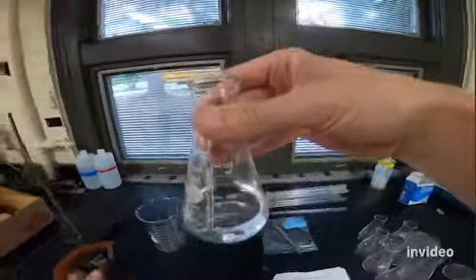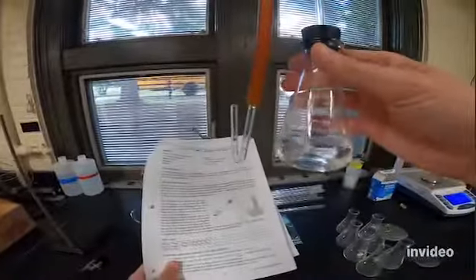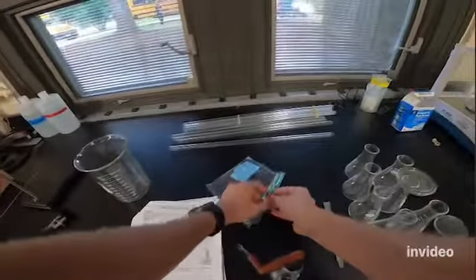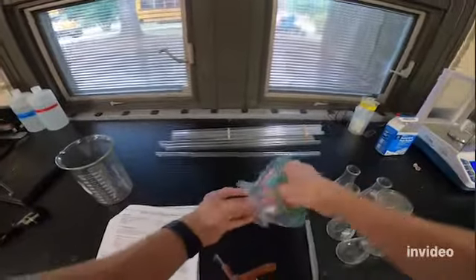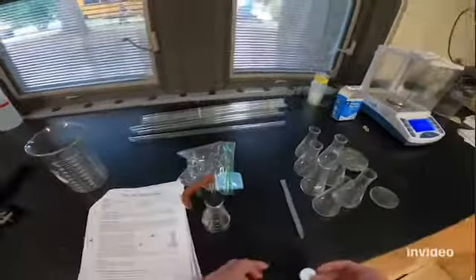Okay, so you can see that I don't have a whole lot of water in there. The actual amount doesn't matter too much. And then I'm going to put the stopper on, and in the data table we're going to record the mass of the flask and the water, and we're going to get an Alka-Seltzer tablet. So you can take an Alka-Seltzer tablet, and we really don't want a whole Alka-Seltzer tablet. That's going to be too much. So we're just going to do a fourth of one. So you guys can share these.